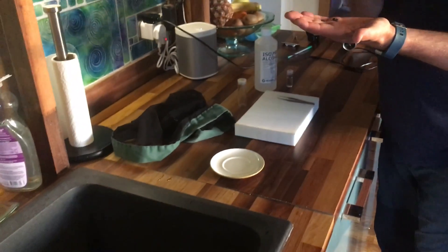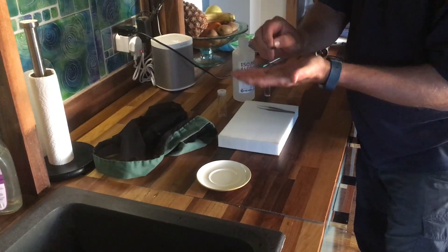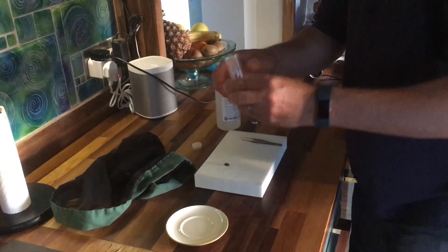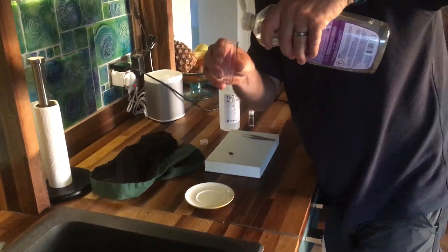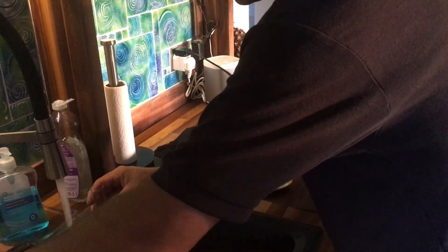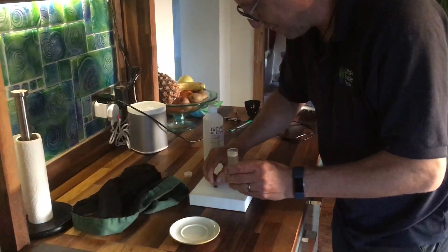What we're doing now is going to give it a clean, so then it looks really pristine and ready to pin. So what we do first is a glass test tube - get the water as hot as you can. One little drop, just one little drop of washing up liquid. Get that water hot again. About that much in it, almost full, three quarters full.